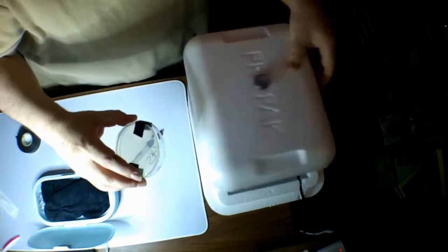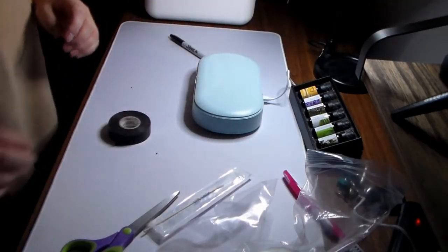Put it in. Let's run this. See what happens. Be right back. Alright people, the sock is done. I'm going to leave it in here while I swab it. I don't want to touch it or anything, but I'll take the swab, I'll swab it in there, and we'll make the culture out of that and see how this works.